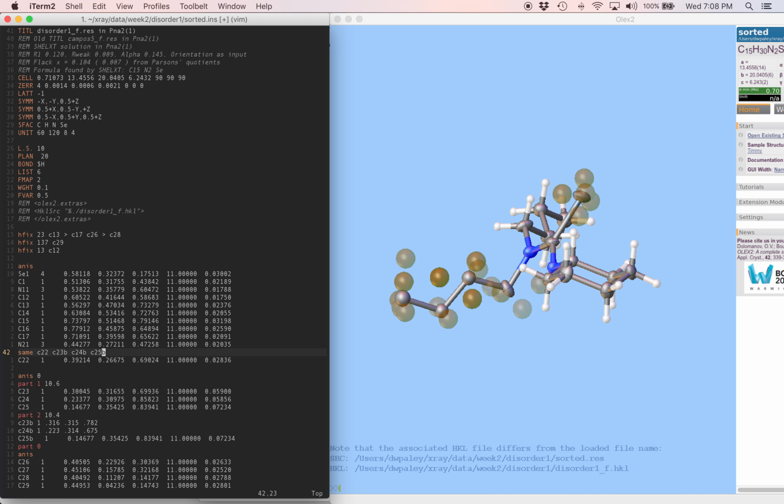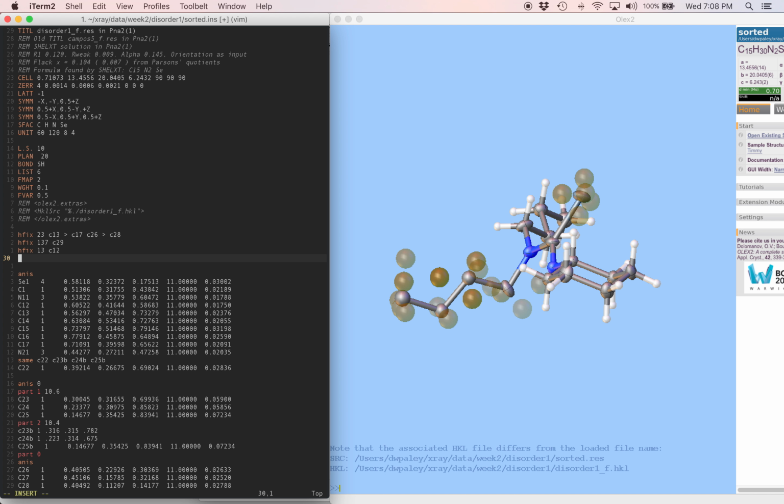There's one more thing that's good to remember for disordered structures. We're going to control the ADPs of overlapping disordered atoms when you have two atoms almost on top of each other. We're going to control that with SIMU for similar displacements. We're going to change the strength of this SIMU restraint. The first two numbers after SIMU give the uncertainty on that restraint, since if you remember it, it gets included as an observation basically when you do the least squares refinement.